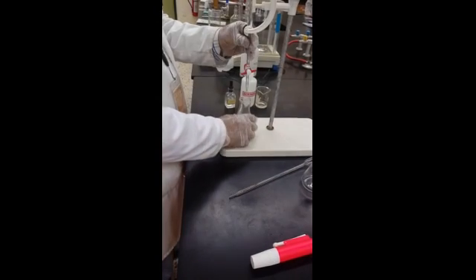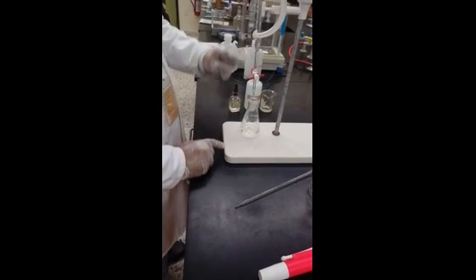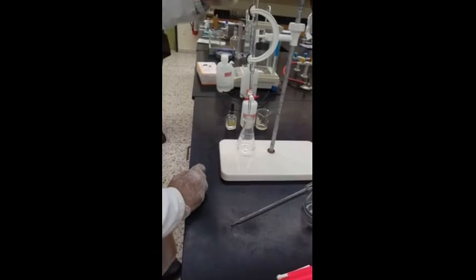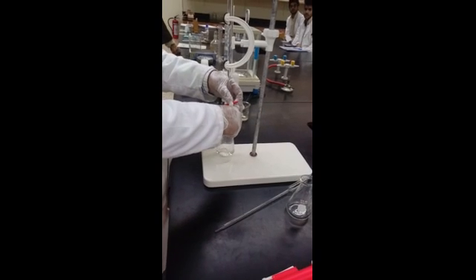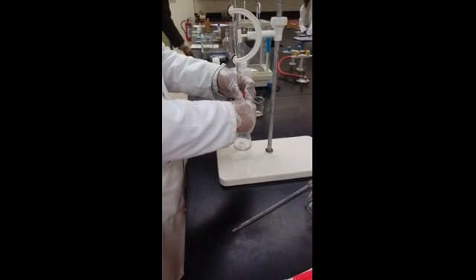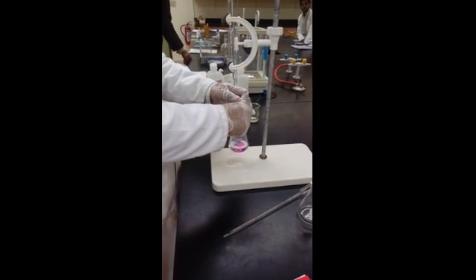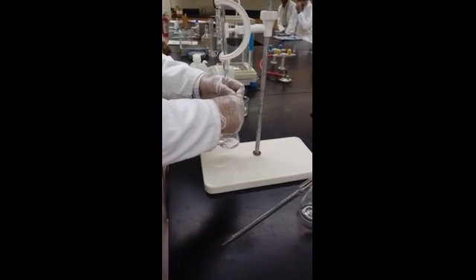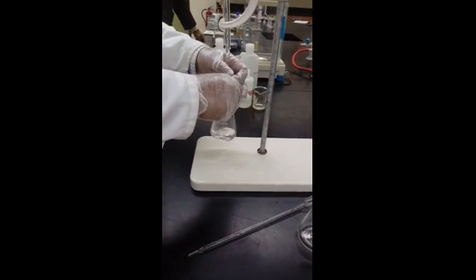Let's start the titration. I have the acid with the indicator in the flask, and in the burette I have sodium hydroxide base chemical. Just start the titration as usual. So hold it nicely, mix it, and open. So you see as I add there is a pink color is coming. Stop and mix it. Disappearing. So it is disappearing.